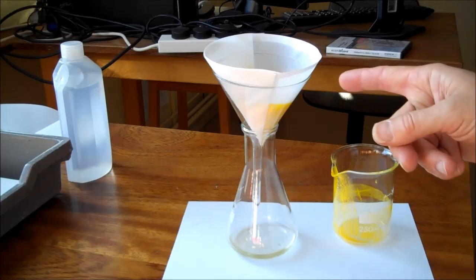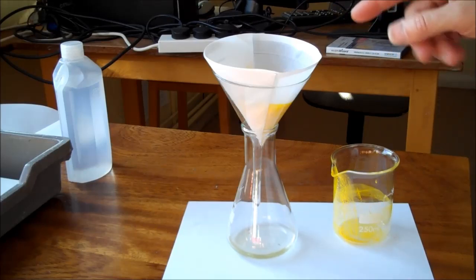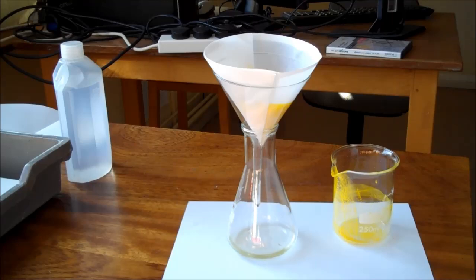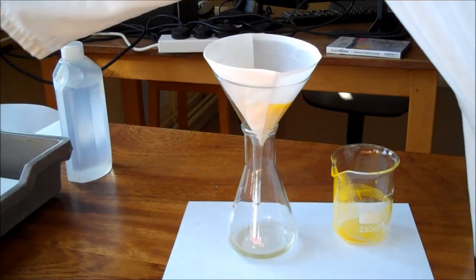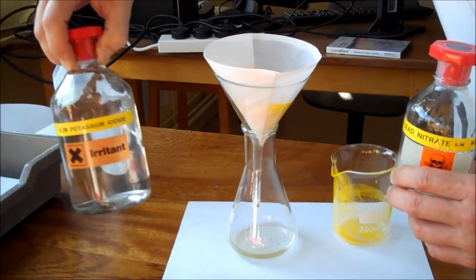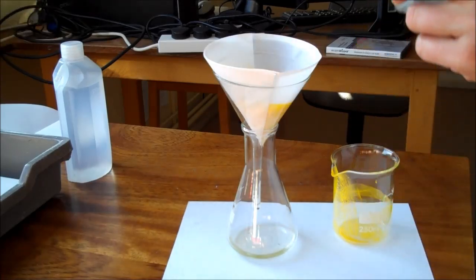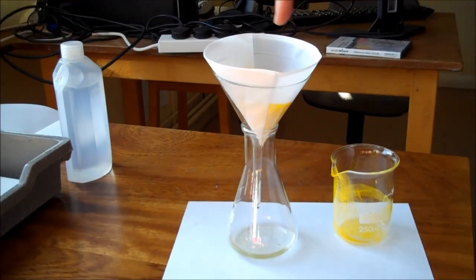We're going to leave it for a while to carry on filtering. Once it's finished filtering we're going to rinse the solid with distilled water because the damp solid will still have some soluble chemicals. There might be a bit of excess lead nitrate or more likely, because I'm using a stronger solution, some excess potassium iodide might be mixed in with the damp lead iodide.